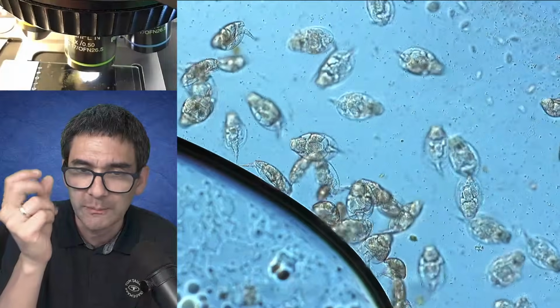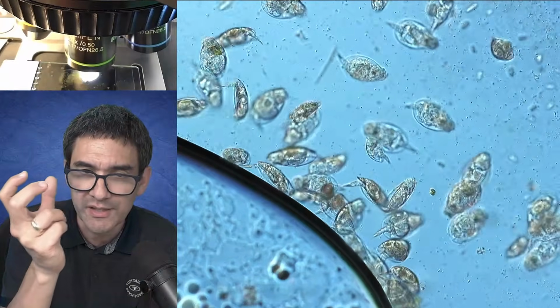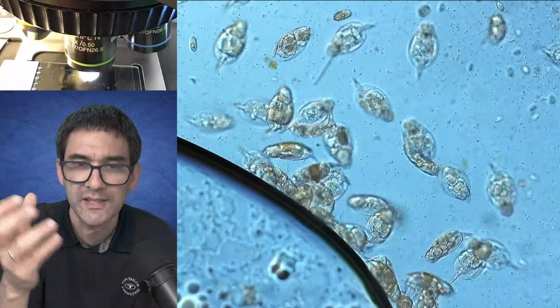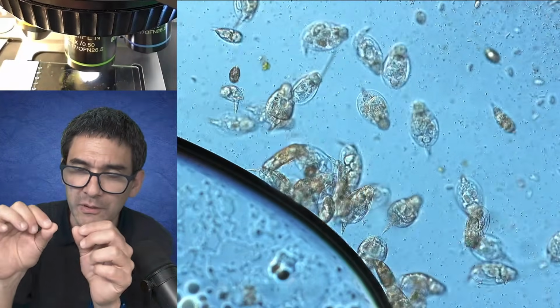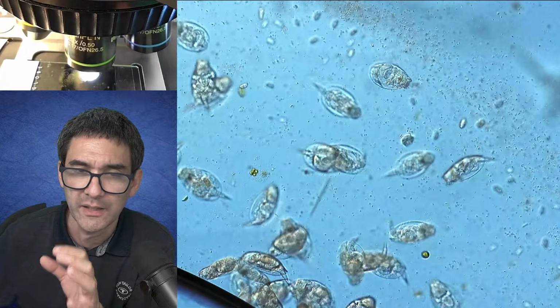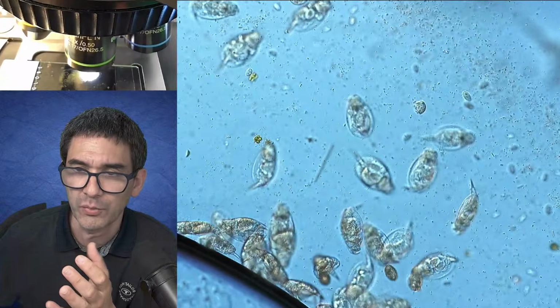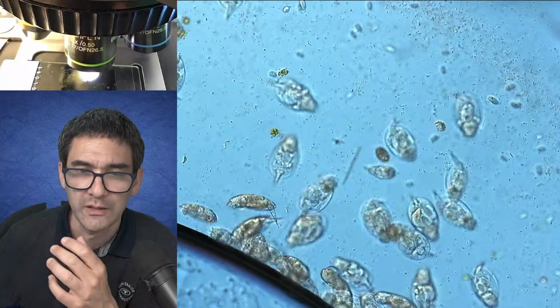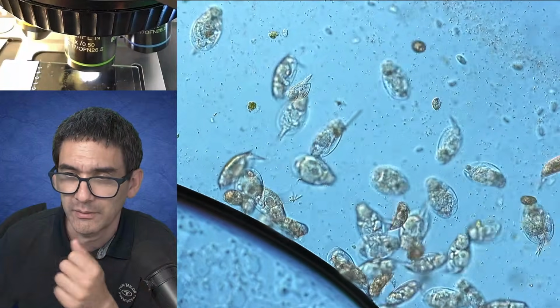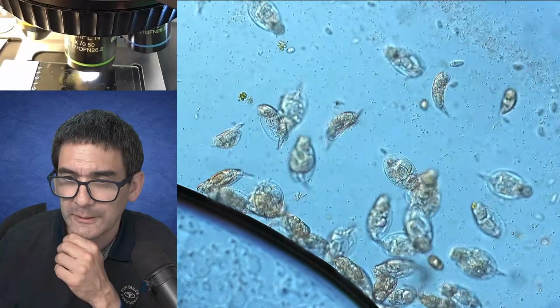The holes are a little bit larger so that you can actually adjust the center, and then you can tighten it again. So in that sense, you can center it, but there is no possibility to dynamically adjust the center of the condenser. At least the model that I have of the 380T, you can loosen the screws and make small adjustments. It takes some patience, however.